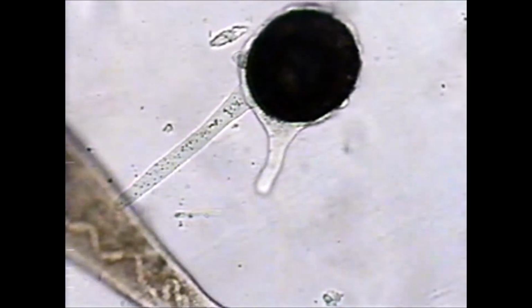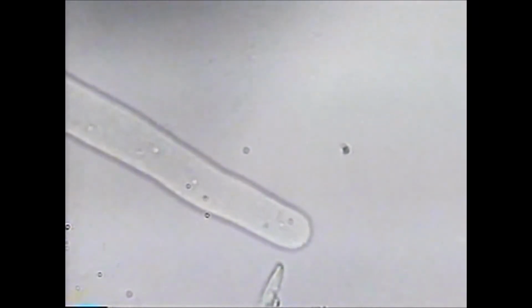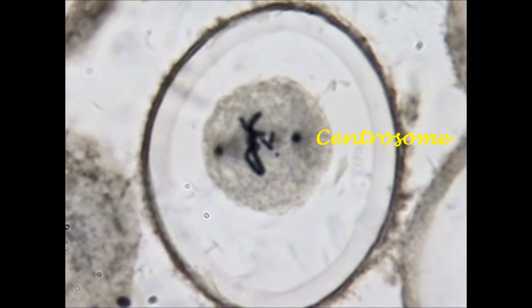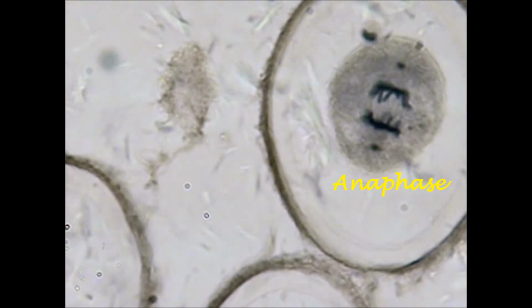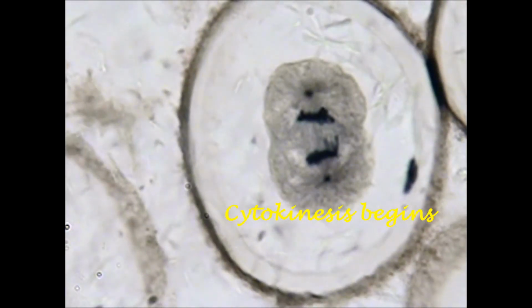Pseudopods of a shelled amoeba. During animal cell mitosis, the centrosomes can be seen, one at each end of the cell. The centrosomes produce the cytoskeletal structure, the spindle. Some of the spindle fibers attach to each chromatid and separate them into new chromosomes. A complete set of chromosomes is pulled to opposite ends of the cell by these fibers.